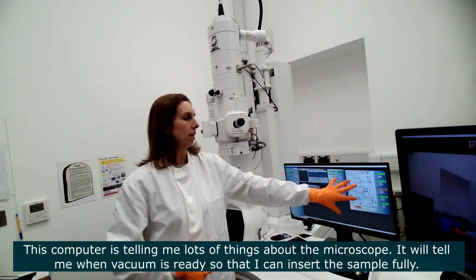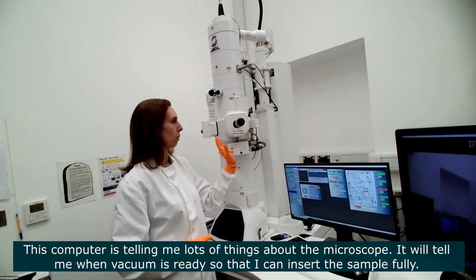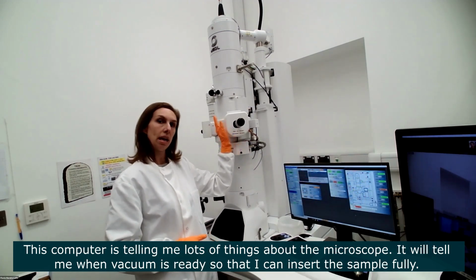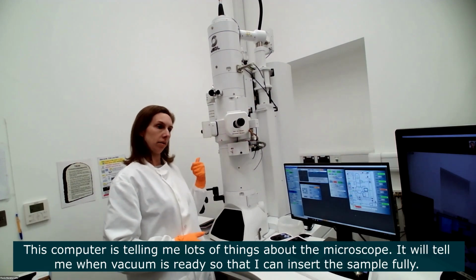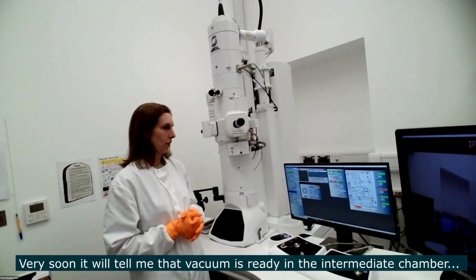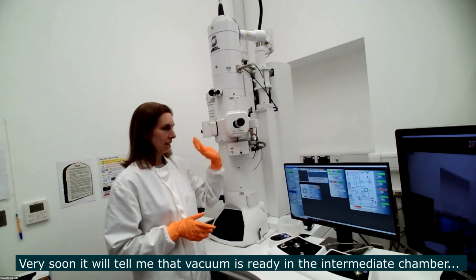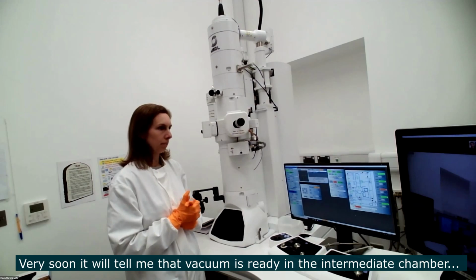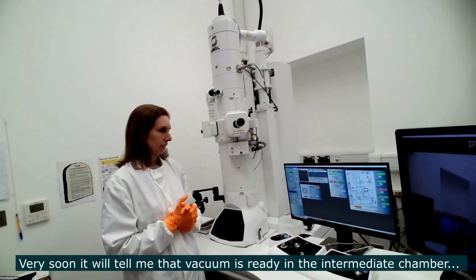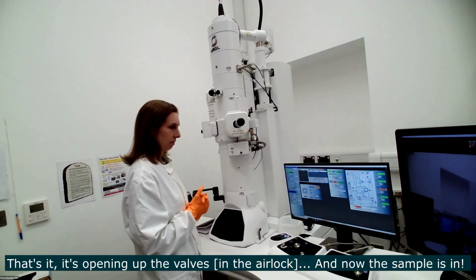On this side, it's telling me that the vacuum is good on several parts of the microscope, and it will tell me when the vacuum is good here, so that I can insert the sample fully. Very soon, hopefully, vacuum will be ready here, and then we can insert the sample. That's it. It's opening up the valves.